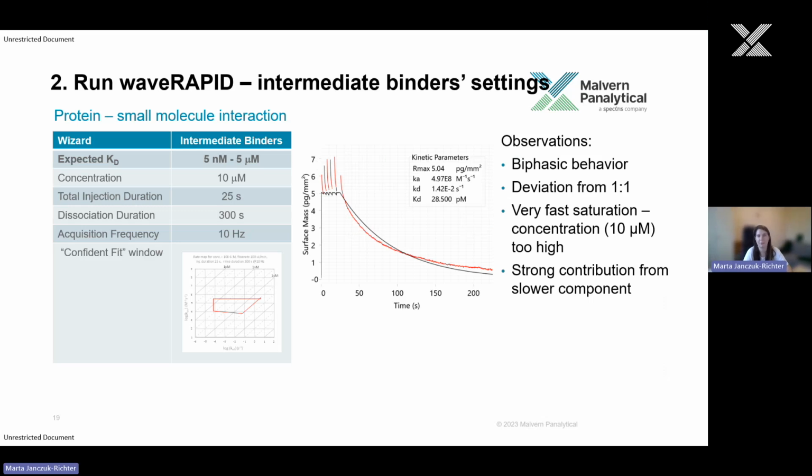Okay, let's run waveRAPID. As we don't know much at the beginning, we only see that there is some binding and maybe it's tighter than we expected. Let's start with intermediate binder settings to see where we are going. So that was the initial waveRAPID experiment done on these samples. And what we can see here is actually looking already quite good. Some of you would say that you are happy with this. Some of you would say, okay, maybe we can decrease the concentration, right?